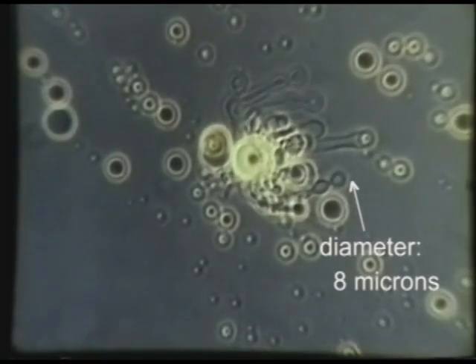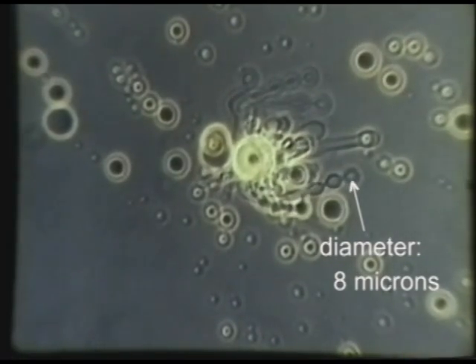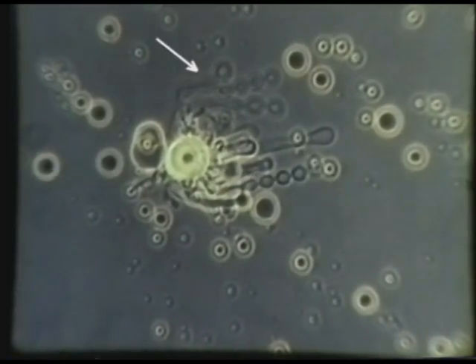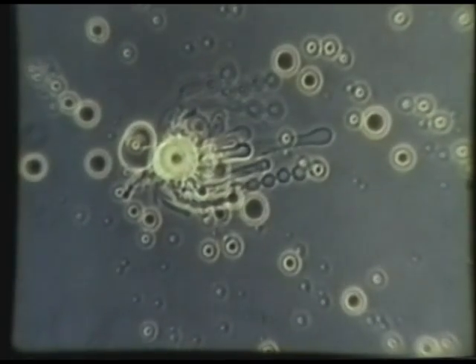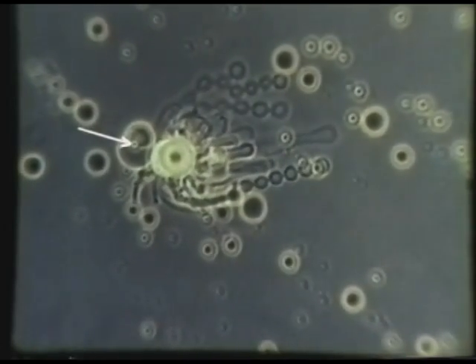A string of interconnected vesicles, about 8 microns in diameter, is projecting from the lower right margin of the large droplet. In the meantime, the tubules above the large droplet have been transforming into strings of vesicles. The small, light-colored triacylglycerol droplet at the left of the large droplet is rapidly disappearing as it converts to a gray disk of lipolytic products.